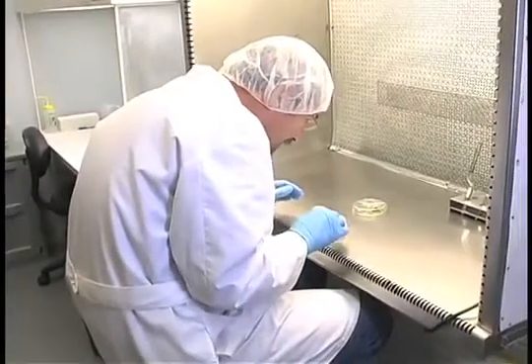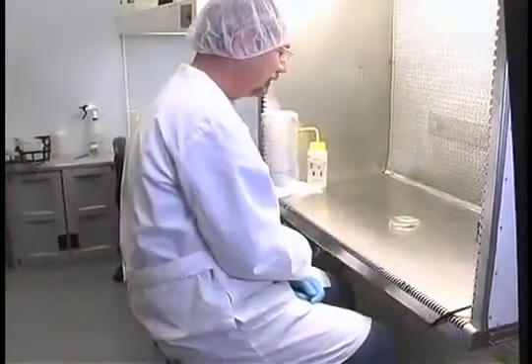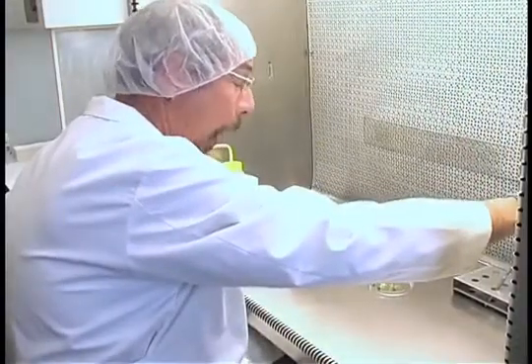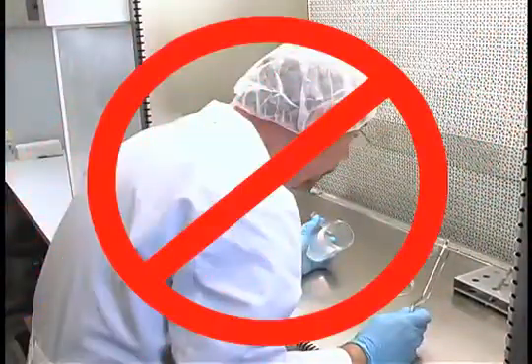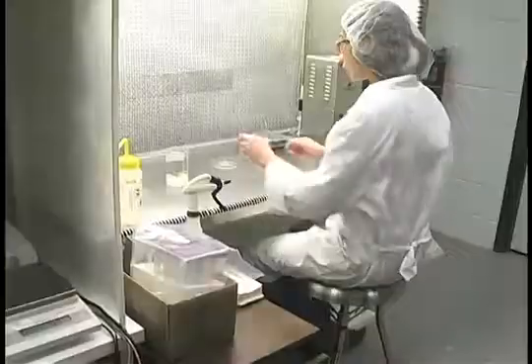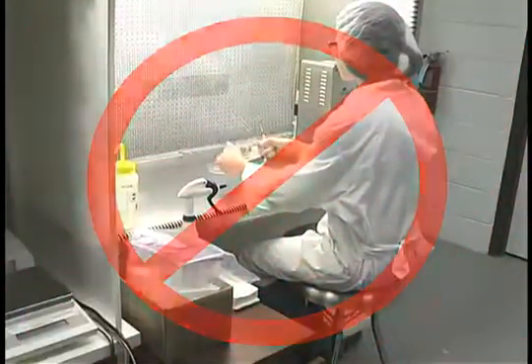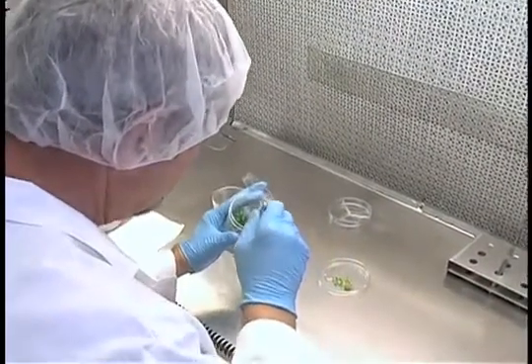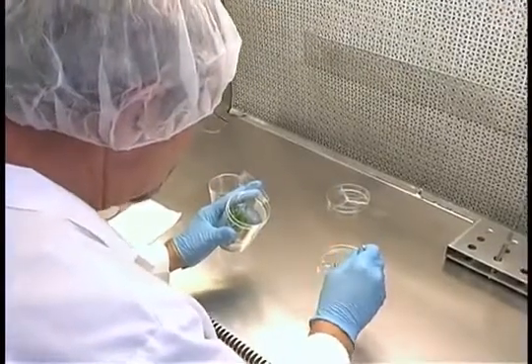Do not lean over the work area. Keep your back against the backrest of your chair. Try to work with your arms straight. This position may feel awkward, but it will reduce contamination. Talking or sneezing while culture material is exposed can also lead to contamination. Work quickly, though — the longer it takes to manipulate the tissues, the greater the chance of contamination.